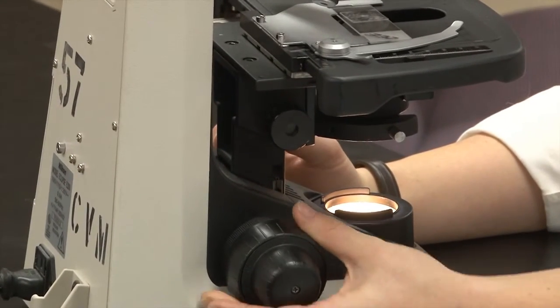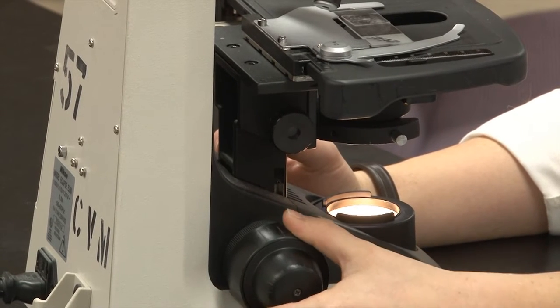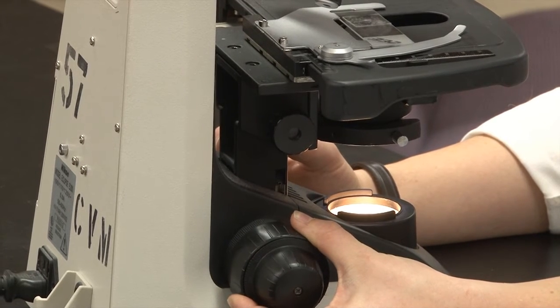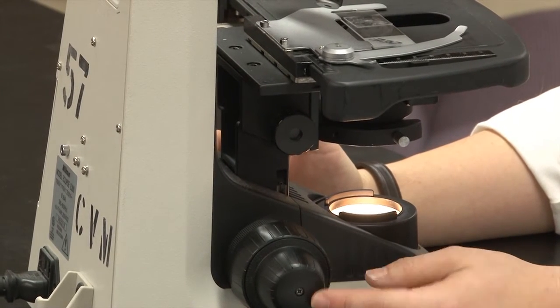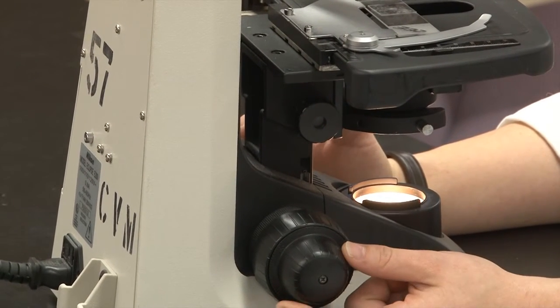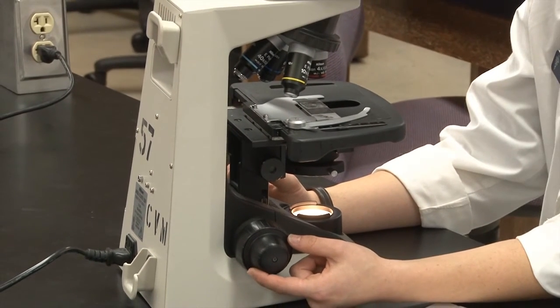First you'll look through and get it kind of in focus — it won't focus it all the way but it'll get close enough. Then you can use the fine adjustment knob, which is the smaller knob. You can see it doesn't move the stage hardly at all, so you'll use your fine adjustment until you get it just right in focus.